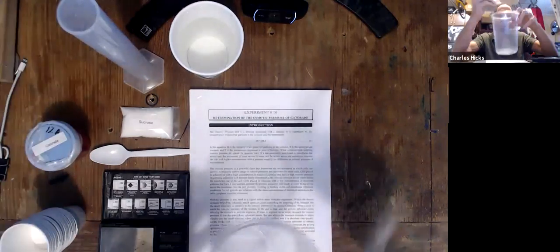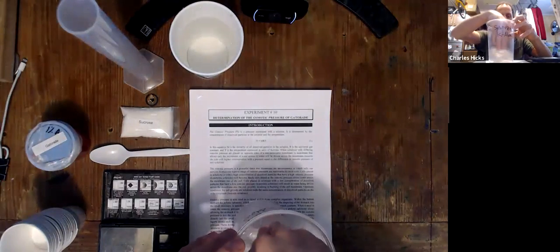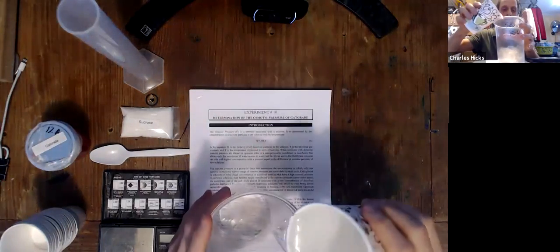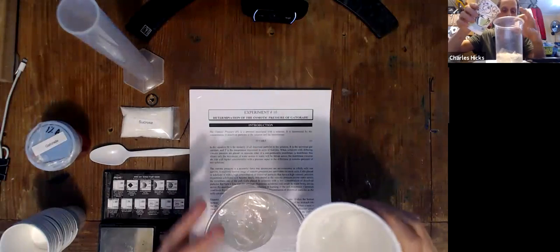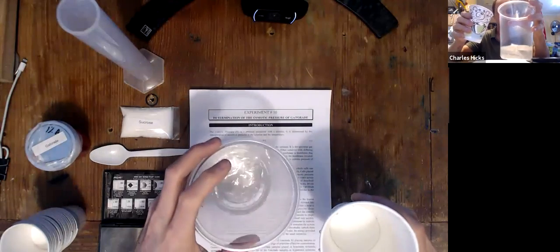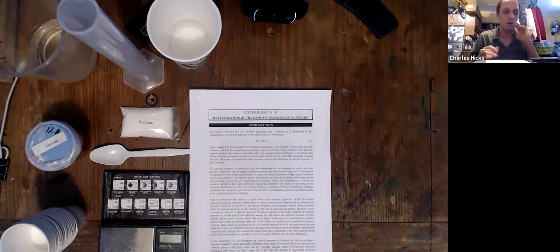So we're going to put them in this quart container from your kit, and we can put some water in there, put in enough water to cover them. Swirl it around a little bit, and we can leave that sitting on the side while we move on to the next part of the experiment.